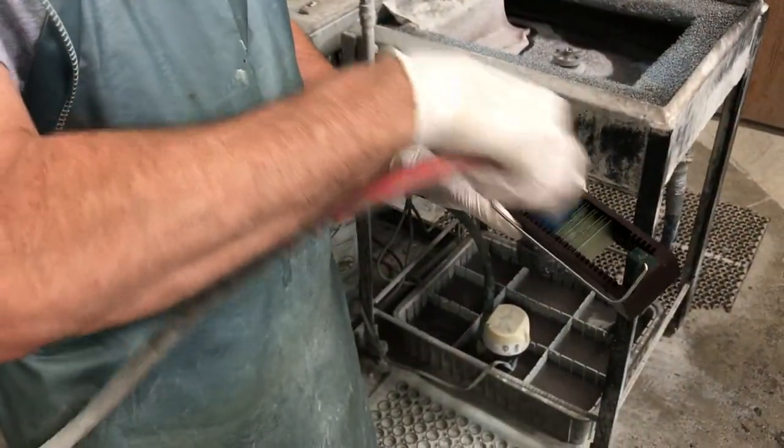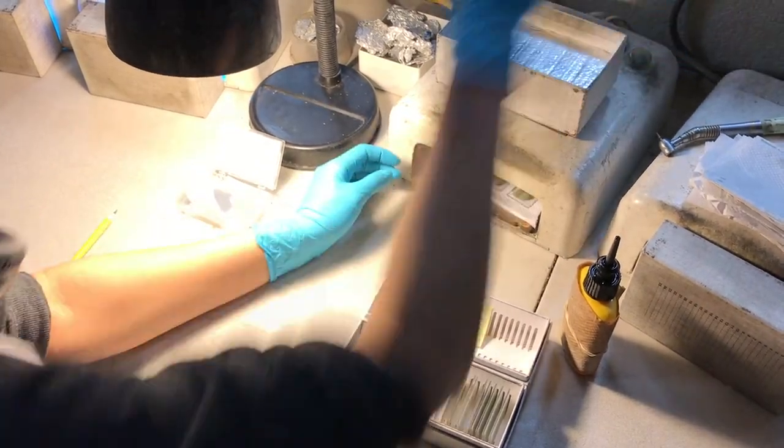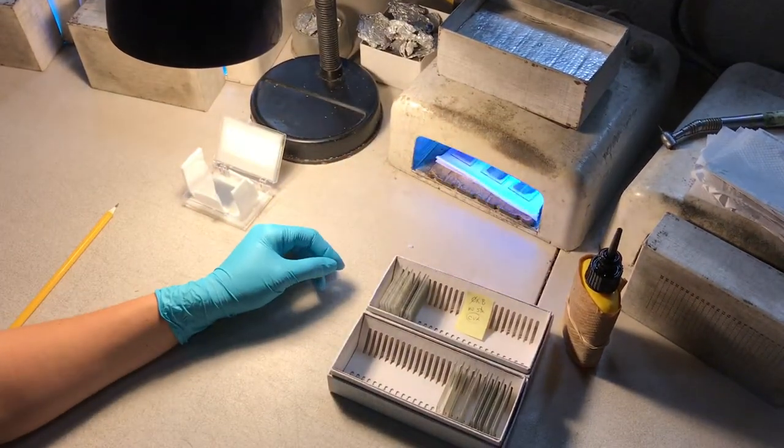Stained sections are dried, then cover-glassed to preserve the stain and improve optical clarity.